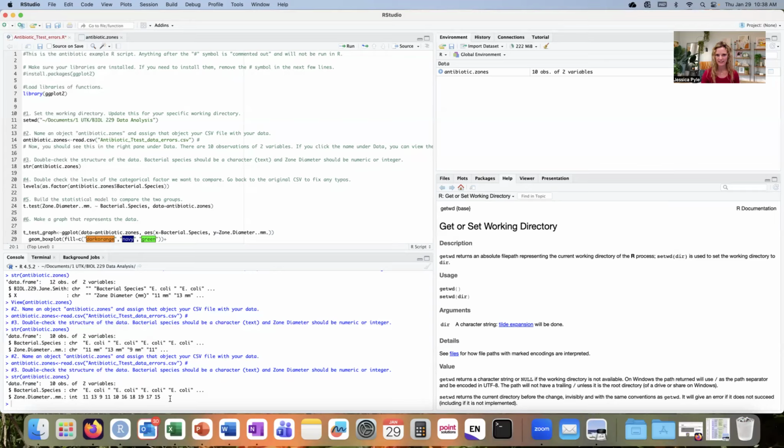If you have any decimal numbers, then it would import as numeric or NUM, and that's fine too. Integer or numeric will both be able to be analyzed by the t-test later. Okay, this looks good. We're ready to move to the next step. So now we want to double check the levels of each categorical factor. Remember, we're running a t-test and there should be 2 categorical factors that we're making a comparison between. So I'm going to go to line number 21 and run this line of code.